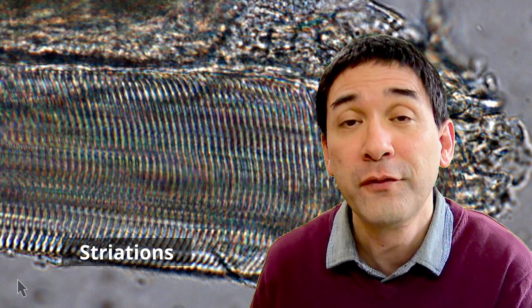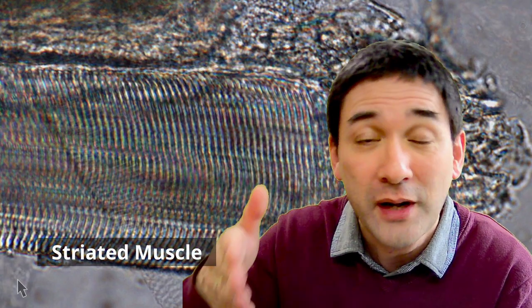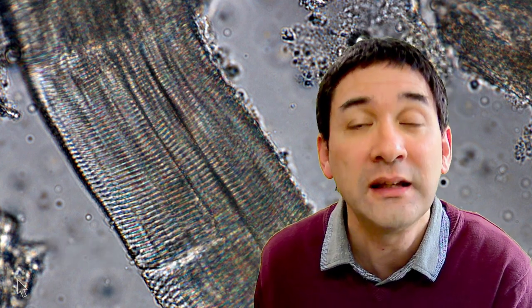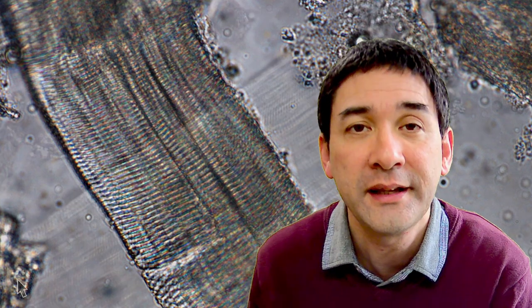At a higher magnification we're already able to see a very typical characteristic of muscles: the so-called striations. Skeletal muscles are also referred to as striated muscles because of those stripes you're able to see here. These striations are the light and the dark bands — they're actually called like that. Later on in the video I'm going to show you their significance and how they are important for contracting the muscle.